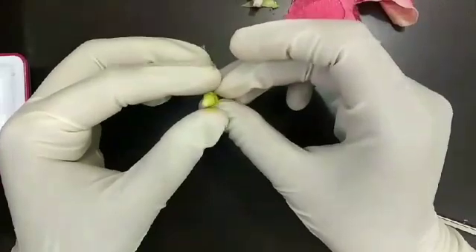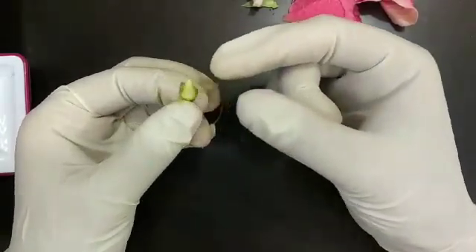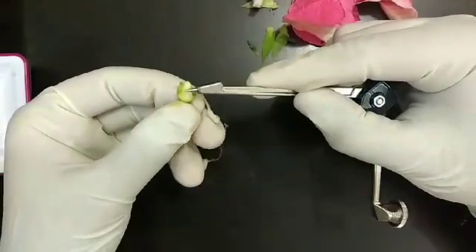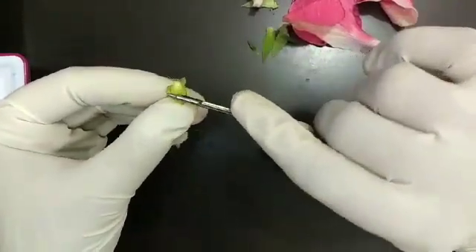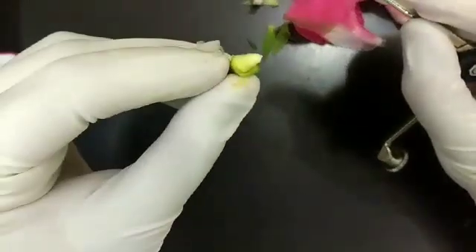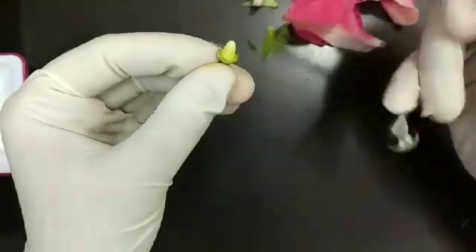This is the ovary that we have got. Now we are going to dissect this ovary to get the ovules — just remove the extra parts. This is the ovary; now we are going to dissect this to get the ovules.